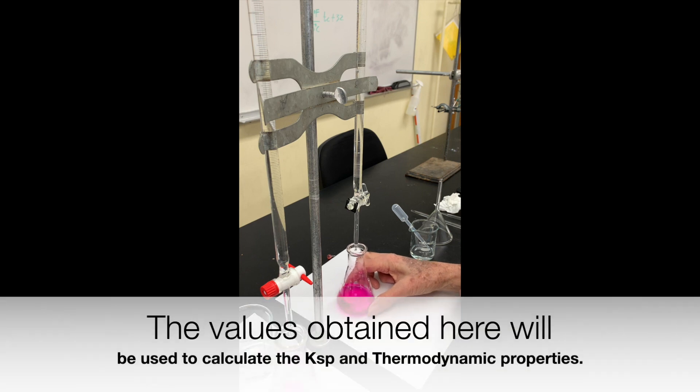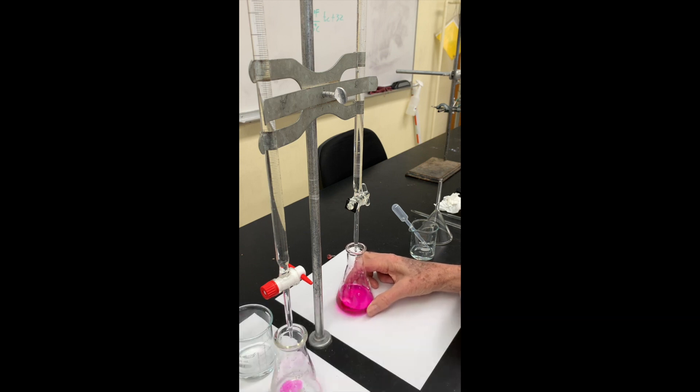We'll use the values that we obtain here to determine the solubility product and to determine some thermodynamic quantities related to the KSP.